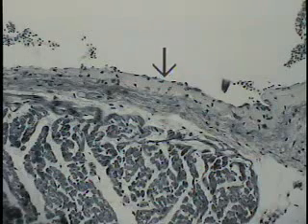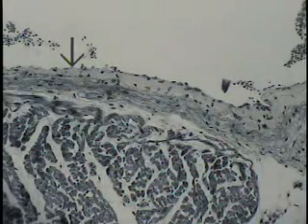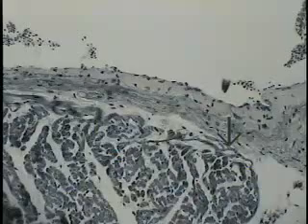The endothelial lining is shown at the tip of the arrow, at this medium power objective. So the endocardium extends from where the tip of the arrow is now pointing to its association with the underlying cardiac musculature of the myocardium. So this layer from here to about here, here to here, here to here, is typical endocardium.